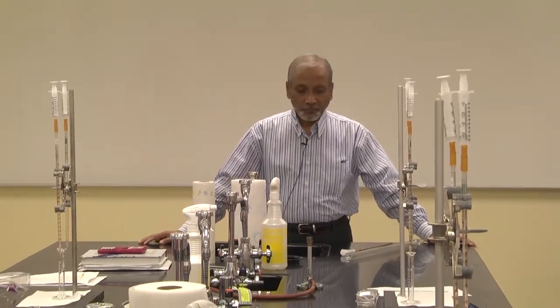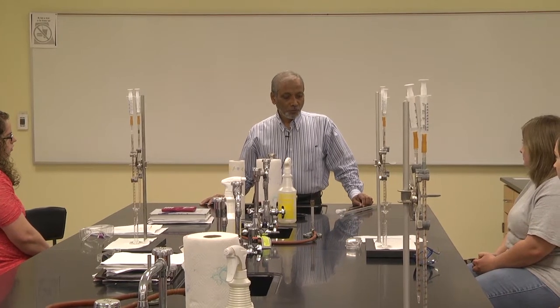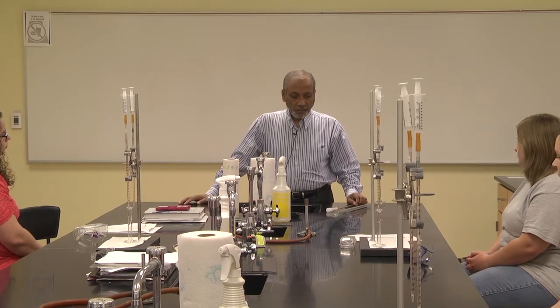So in this experiment, you are going to use vinegar. Everybody is familiar with vinegar, right? What is there in vinegar? Acetic acid. So vinegar contains acetic acid, right? So one of the questions can be, how much acetic acid is there in vinegar? Can we find that out? That's exactly what you are going to do today in this experiment. You will calculate the amount of acetic acid in vinegar. And the way you will do it is by an acid-base titration, a microscale acid-base titration.